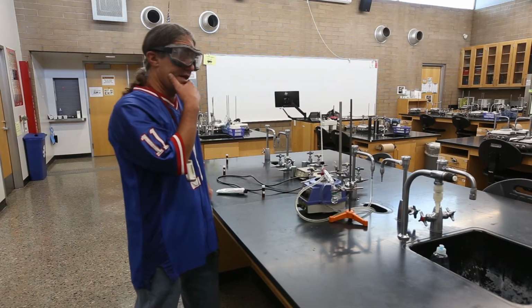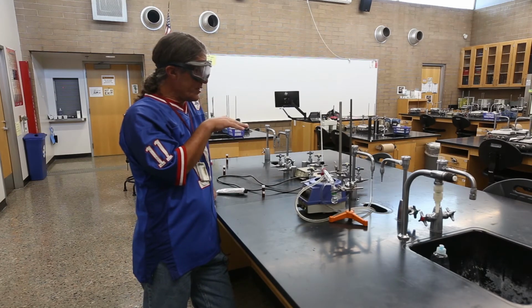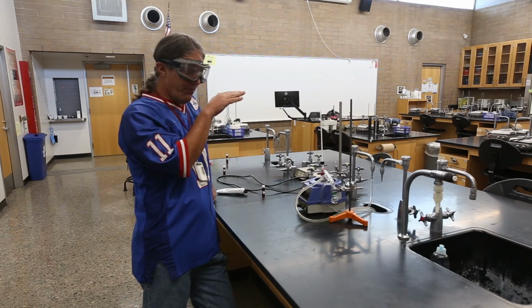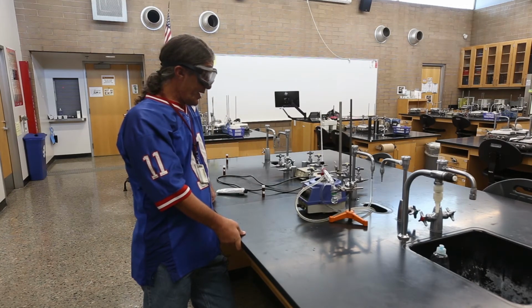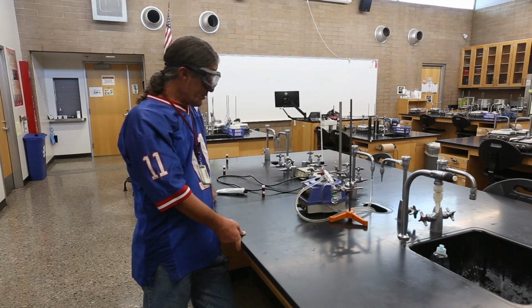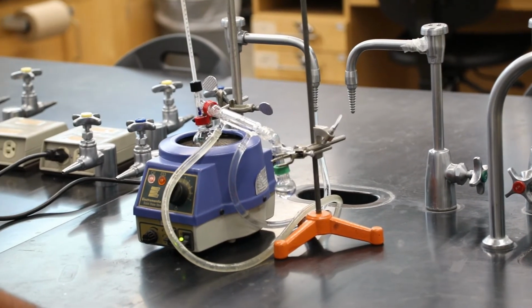Celsius. And I want to think to myself, is that too hot to touch? What's 66? 37 is body temperature. 40 degrees is a hot summer day. 66 sounds like something I really don't want to touch right now. So we're going to let things cool off before we disassemble. It's like popcorn popping. The bubbles over here are slowing down, but they haven't quite stopped yet.